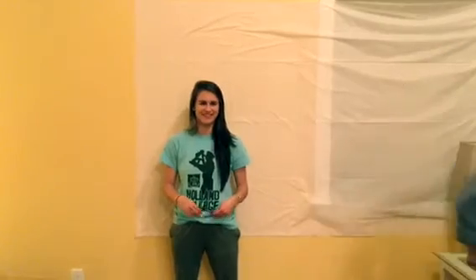And finally, my assistant Emily will show you the proper technique to putting on and taking off a pair of safety glasses. Open up the safety glasses and adjust the arms for a proper fit. When putting on the safety glasses, ensure that you do not hit your eye. To remove the safety glasses, simply take them off and fold them up.